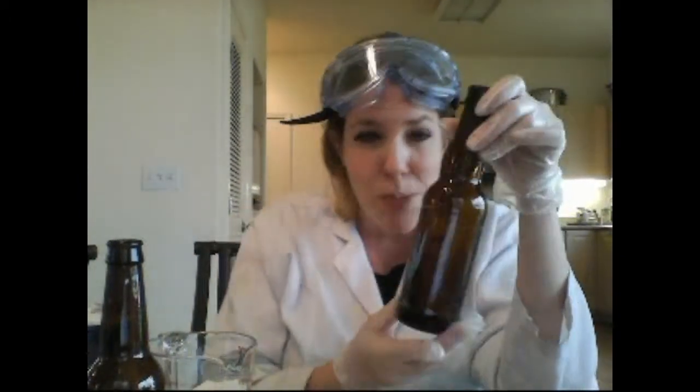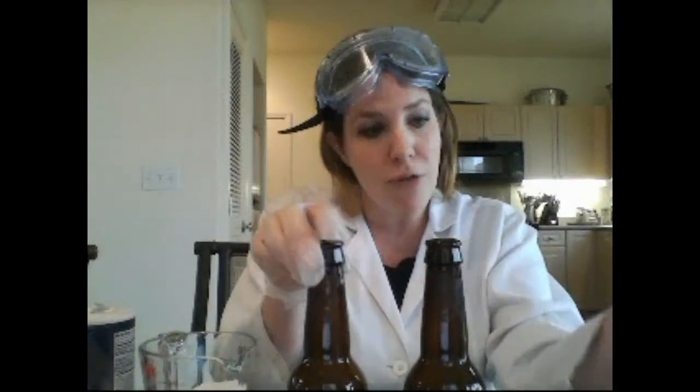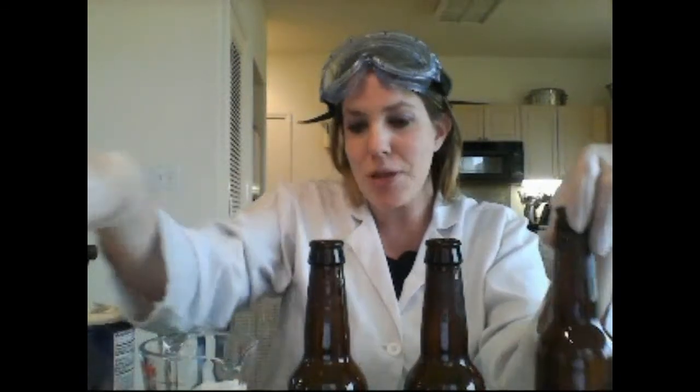We're going to work with four different treatments, so you're going to need some long-necked bottles — beer bottles or old-fashioned soda bottles. These happen to be beer bottles. Ideally, you want all four of them to be the same so that we're controlling for bottle type. I got my four long-necked beer bottles here — clean and empty.